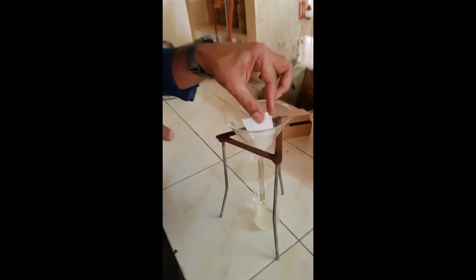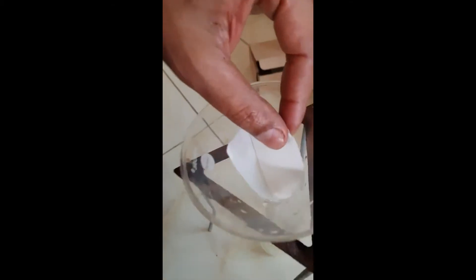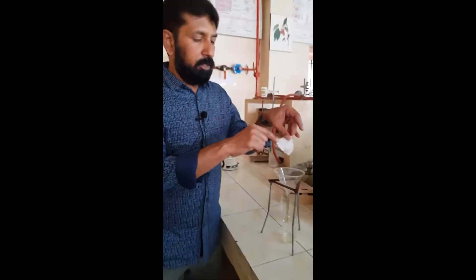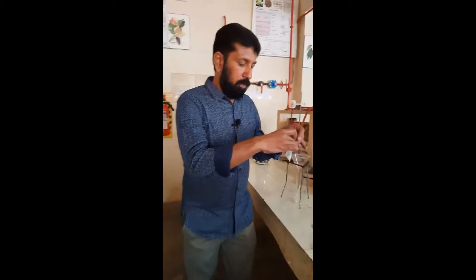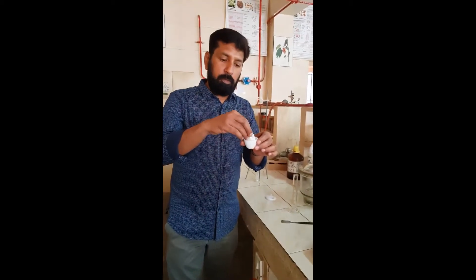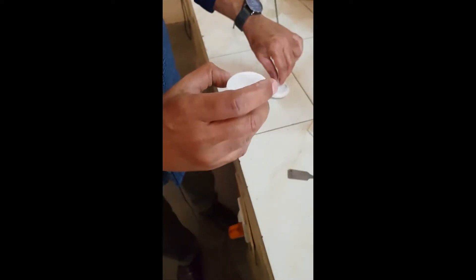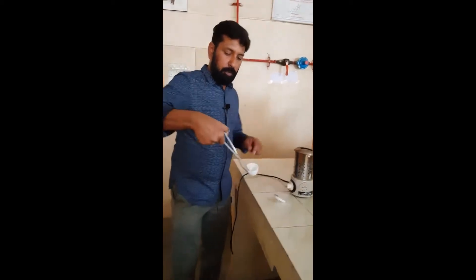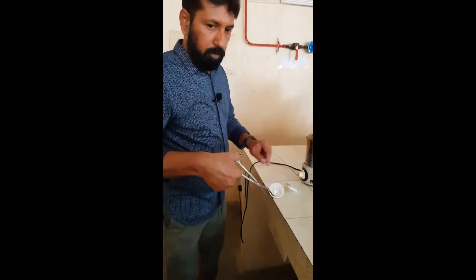You are pouring the complete solution into this funnel. It is filtering. So after filtering, take this ashless filter paper which contains the insoluble matter. Now just fold it and keep it into the crucible and close it. Take it with tongs — the ashless filter paper is now in the crucible.